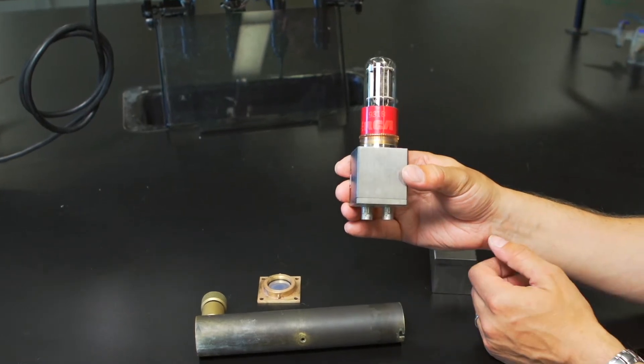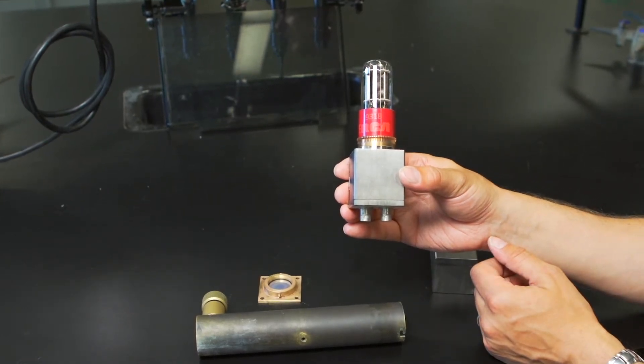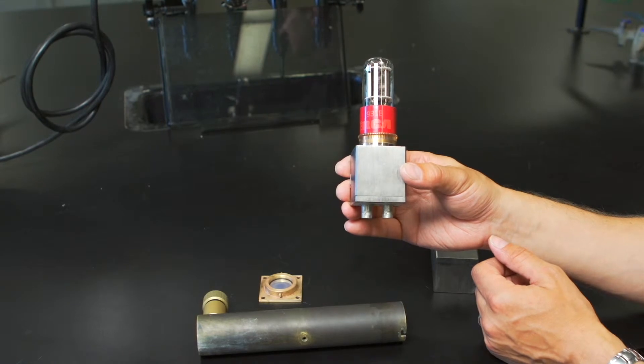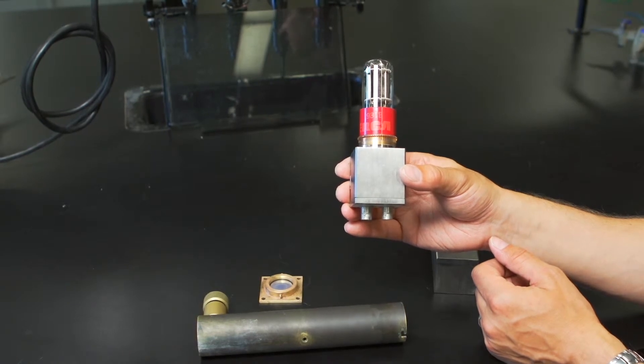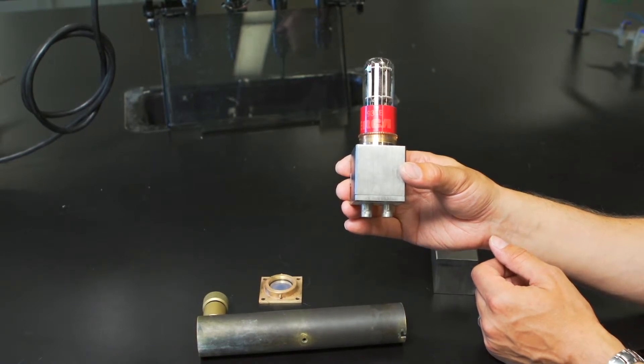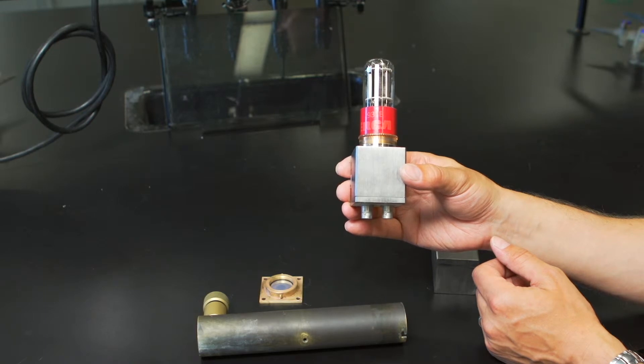It's important to note that when the sample is injected into the cell compartment, the voltage power supply is on, but when cleaning the cuvette, the power supply must be turned off to prevent damage to the PMT. Excessive light intensity on an activated PMT will permanently reduce its sensitivity.